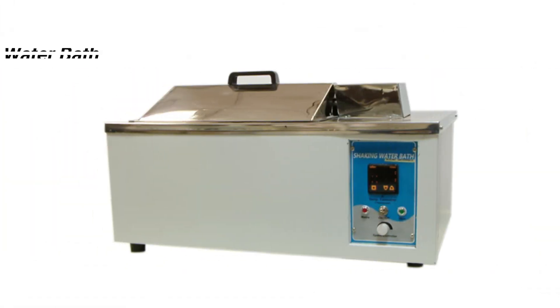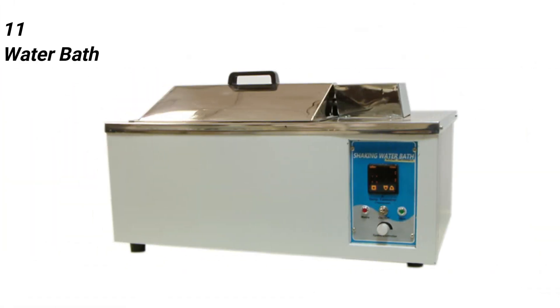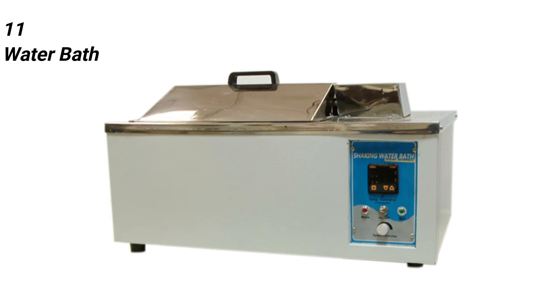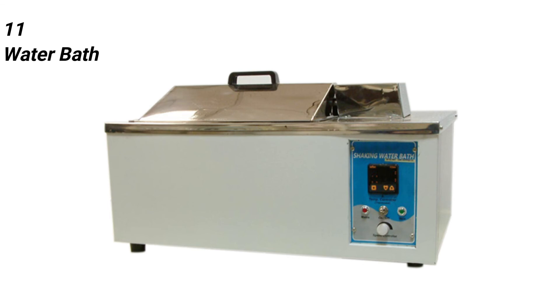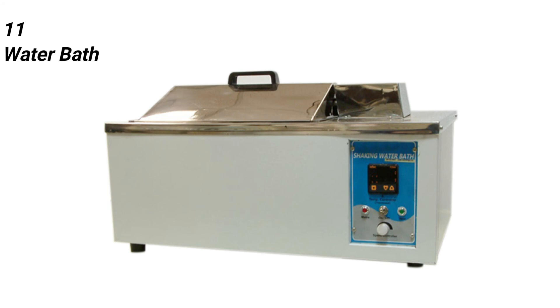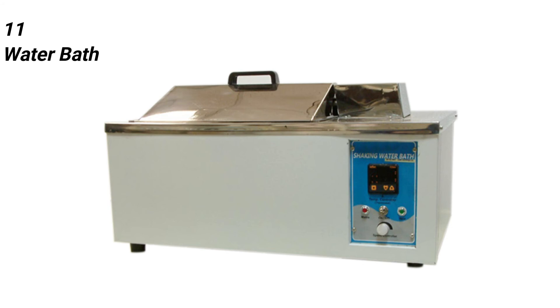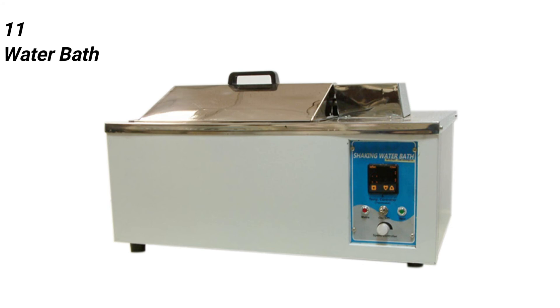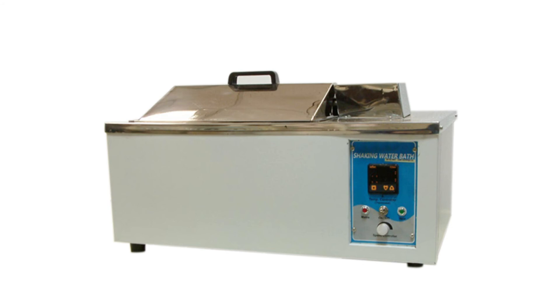On number 11, I would like to tell you about water bath. A water bath is a conventional device that is used for chemical reactions that require a controlled environment at a constant temperature. Water baths are primarily used for heating samples under a controlled temperature and are suitable for heating chemicals that might be flammable under direct ignition.